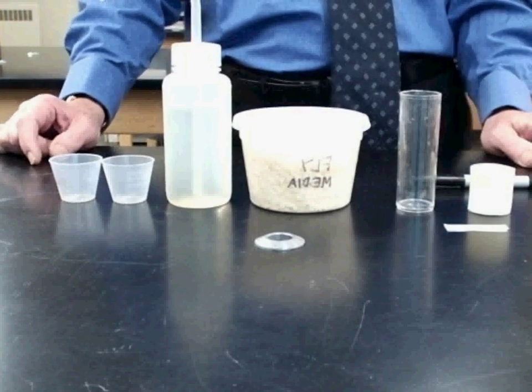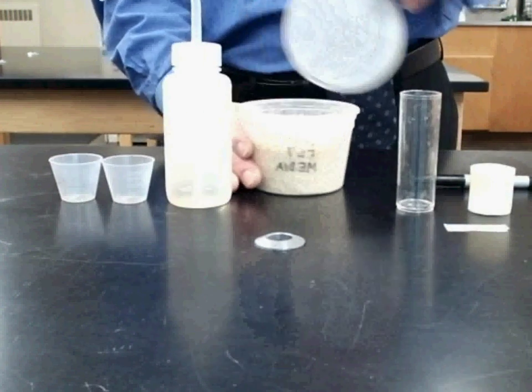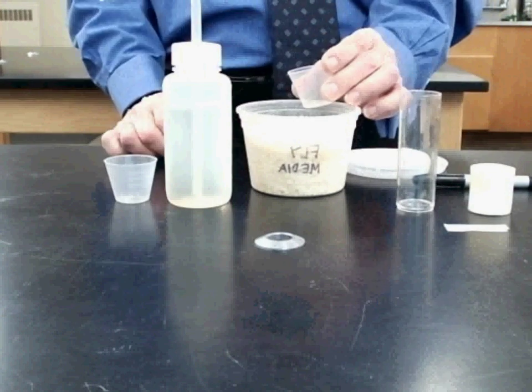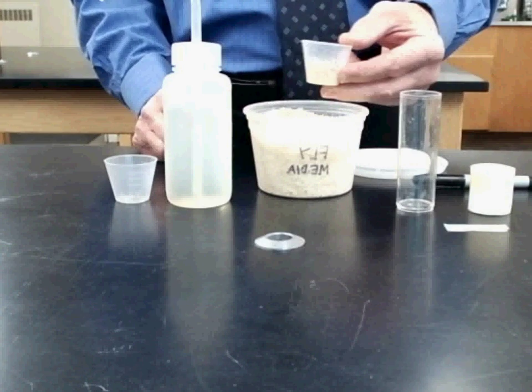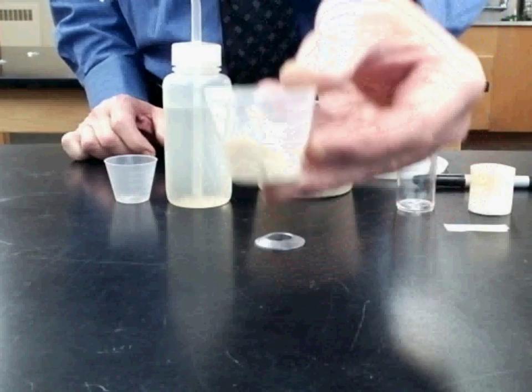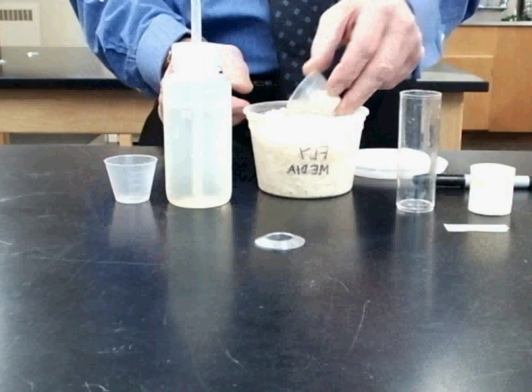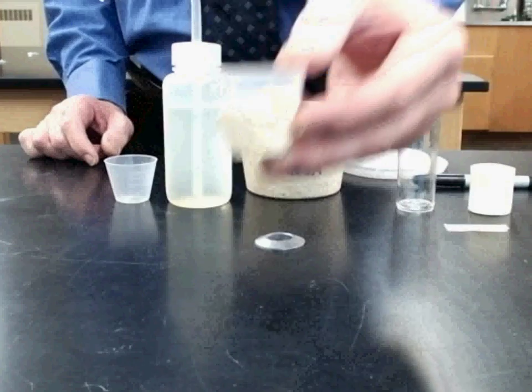It's really very simple. What you do is first get your media. You can do that by scooping your measuring cup into the media and getting about 20 to 30 mLs, which is about half a cup of the media, maybe a little bit more. What's nice about this preparation is it's not exact.